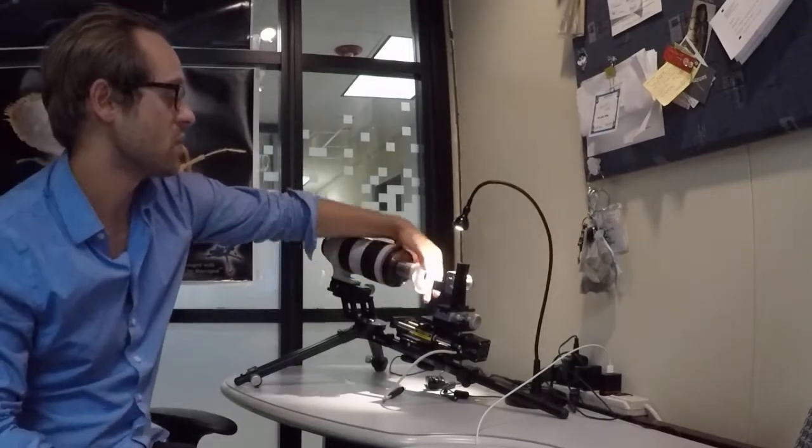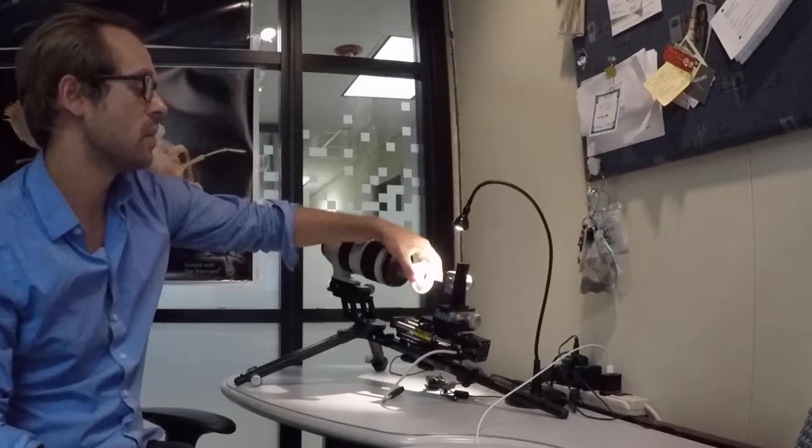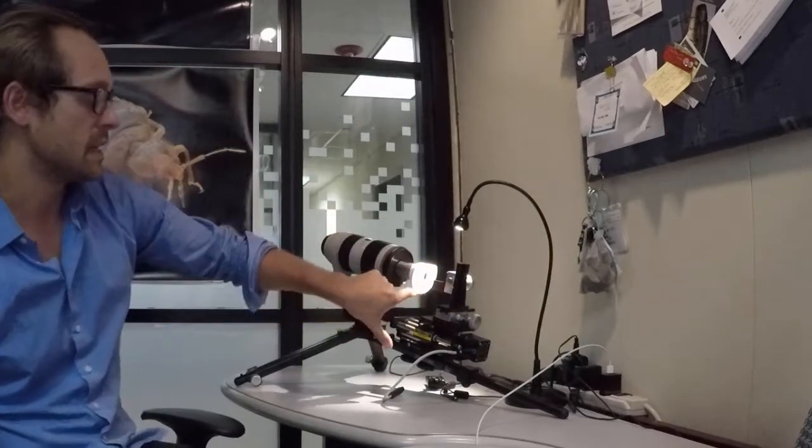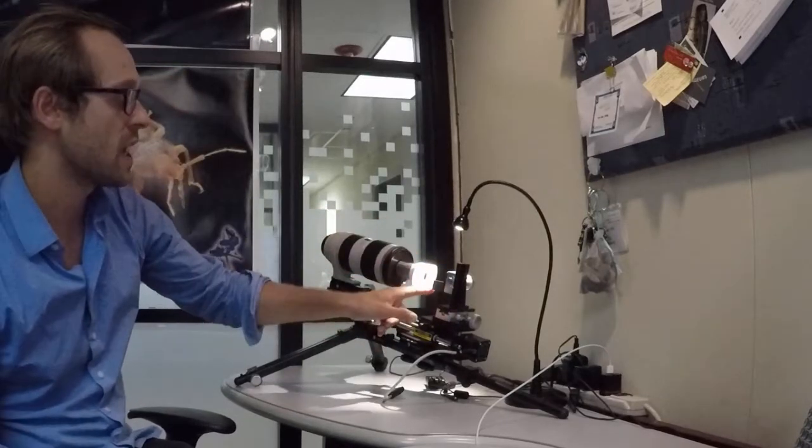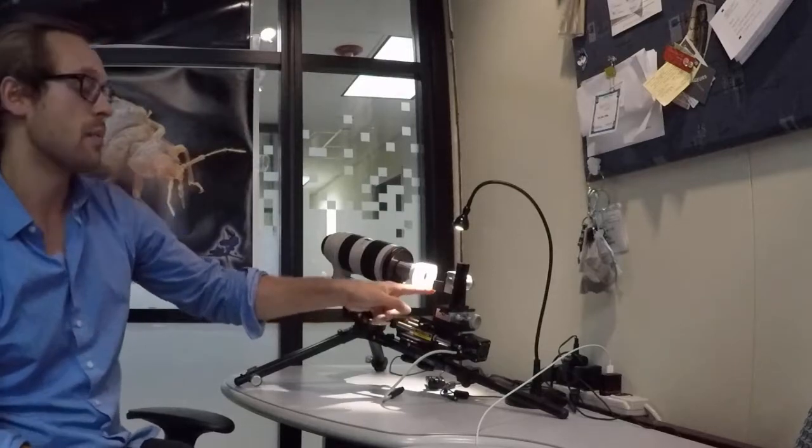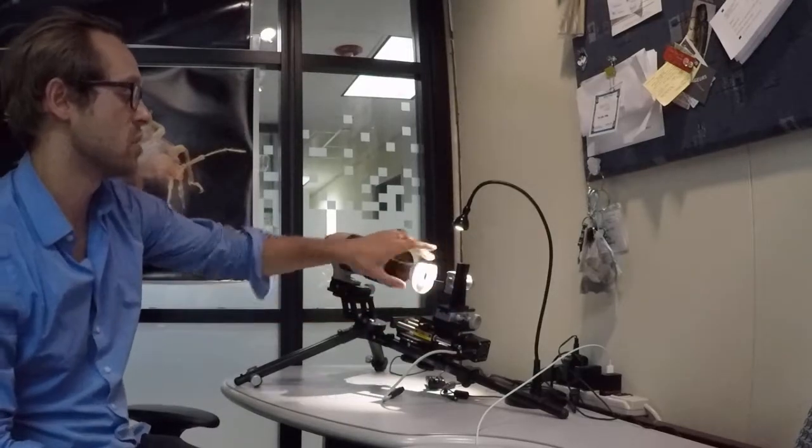So what we're going to do is take this diffuser and just have the flat ends on the top. That way we do have a lot of light hitting this lower barrier here and I don't think we're going to have any issues with our sample getting too close to this objective.